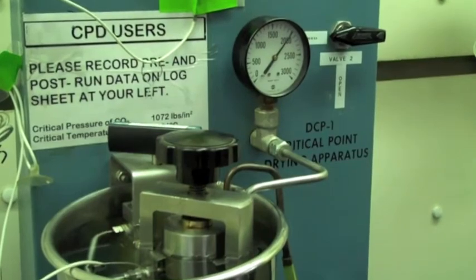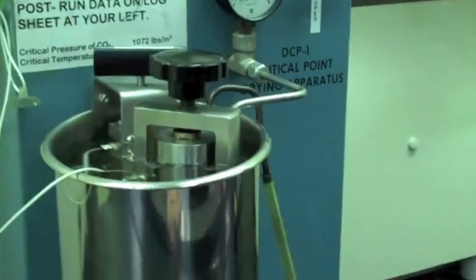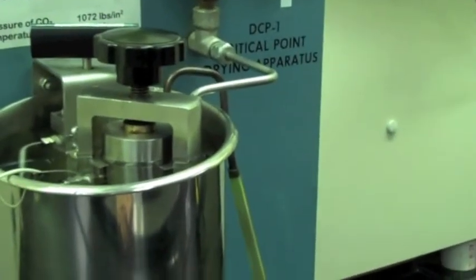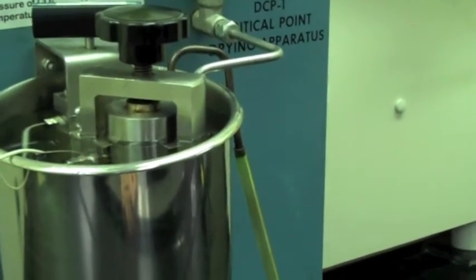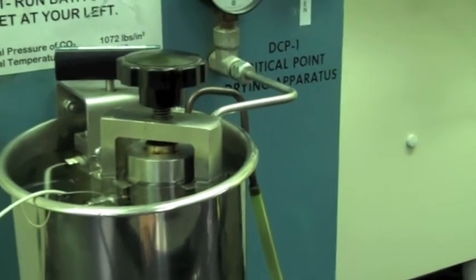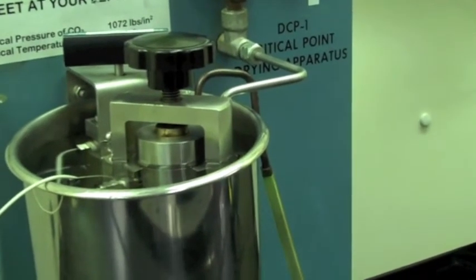So the valve is close. Valve one is close. Adjusting. But now you've just adjusted the number one valve to a hundred. Yeah. We're down now to 1950 and we've got twenty seconds to go.